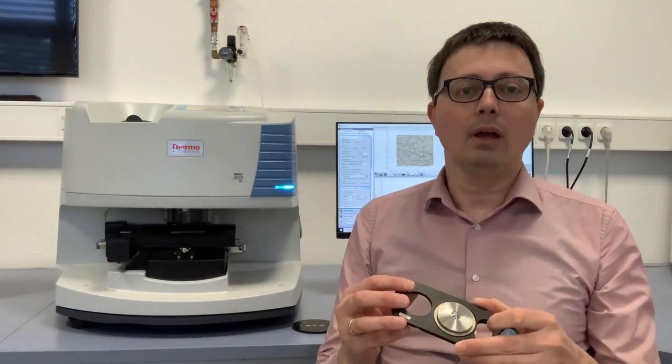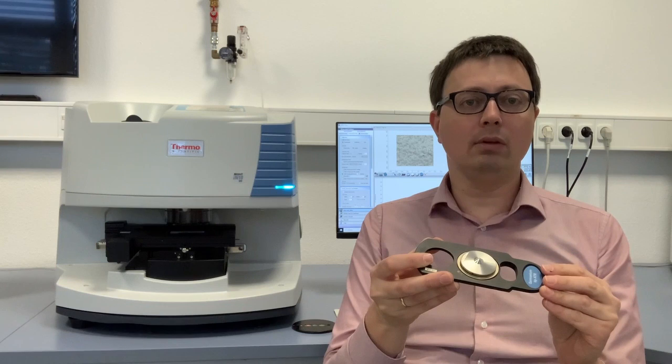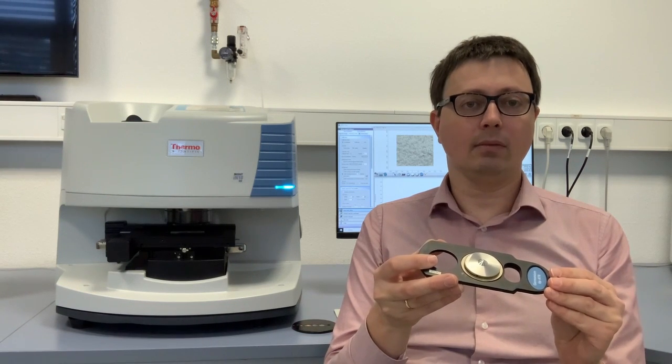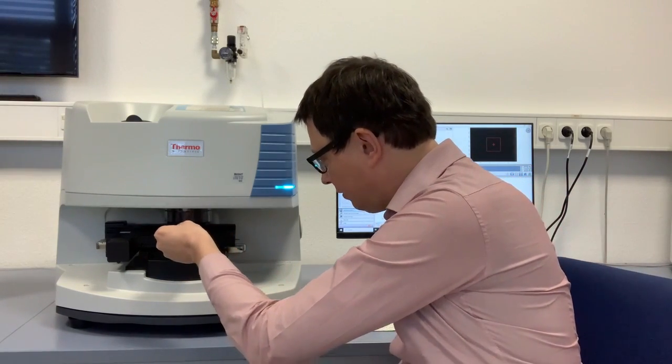With every infrared microscope you can collect data in transmission mode, reflection mode, or in ATR mode. For our system we have a so-called tip ATR, which means that our crystal is not integrated in the objective of the microscope. Instead we have a slider, and here you can see the ATR crystal which could be either a diamond crystal or a germanium crystal. The slider is then placed underneath the objective via a dovetail mount for data collection.